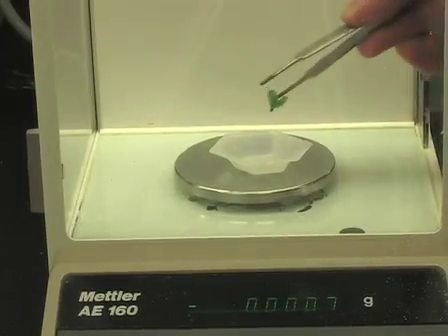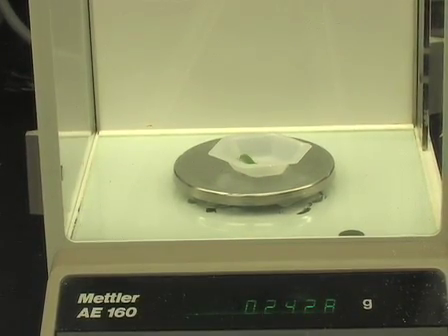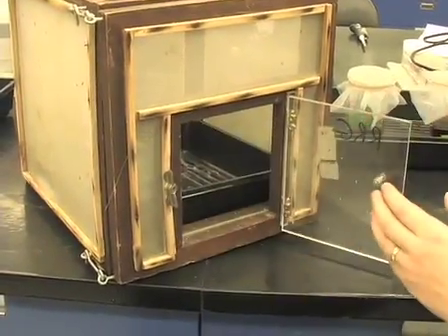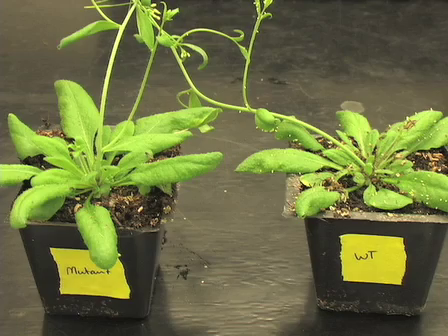I've just shown you how to set up experiments to determine resistance against insects. The first experiment was a no-choice experiment where we compared larval weight gain on mutant versus wild type plants. The second experiment, a choice experiment, compared oviposition by a female butterfly also on a mutant versus a wild type plant. Thanks a lot — I hope it's useful for your experiments.